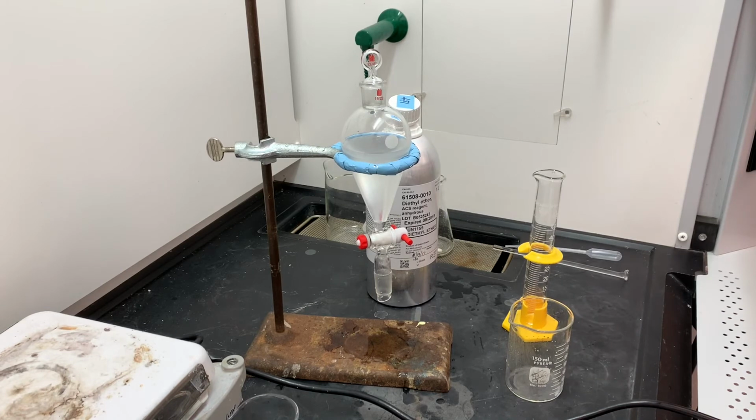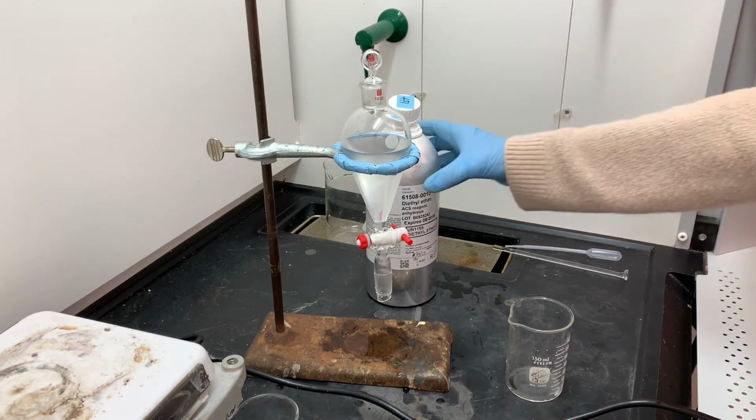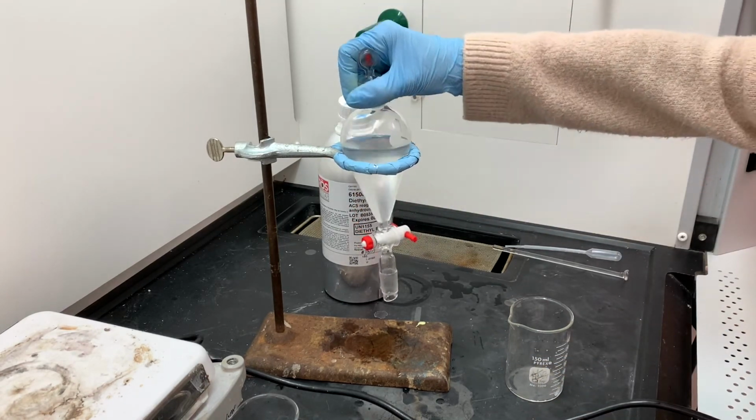So once these two layers have separated, and I can see a clear division between the aqueous layer and the ether layer, I'm going to drain the aqueous layer, and it is going to get discarded. It's going to go into the waste container. The aqueous layer just contains byproducts, doesn't contain anything that's worthwhile. The ether layer that's in the separatory funnel right now is going to be combined with the very first ether layer that I removed. So the two ether layers will be put together.